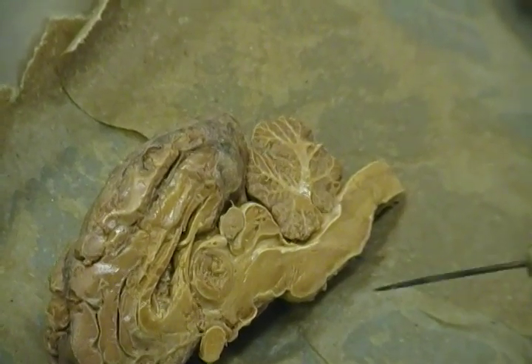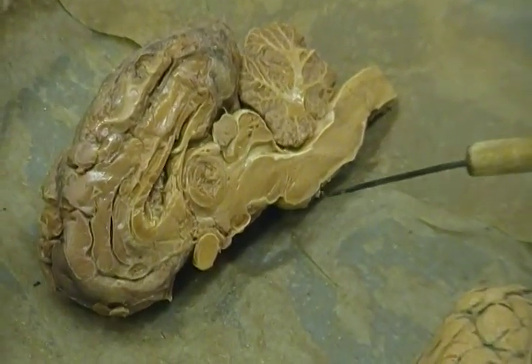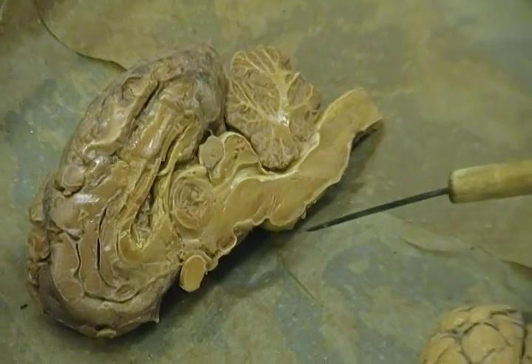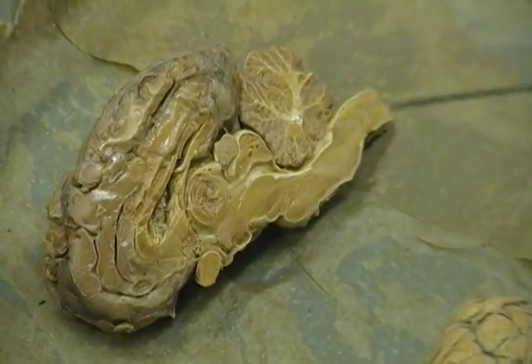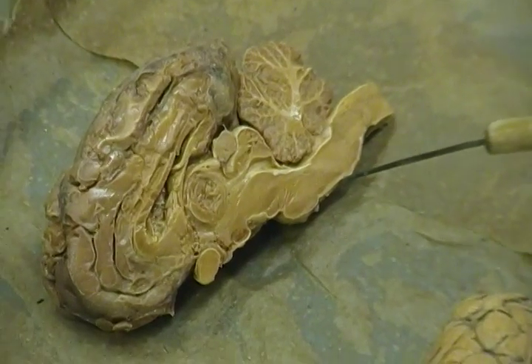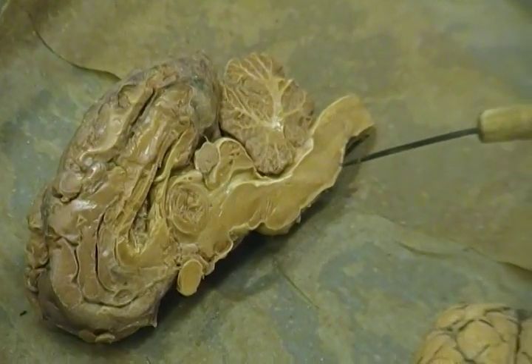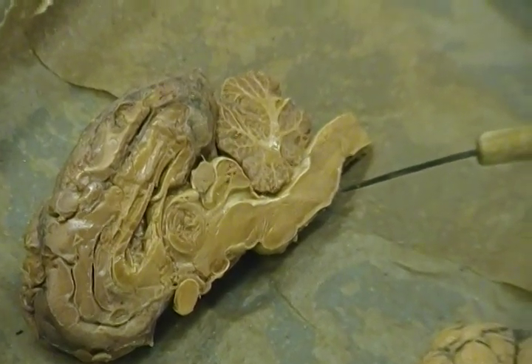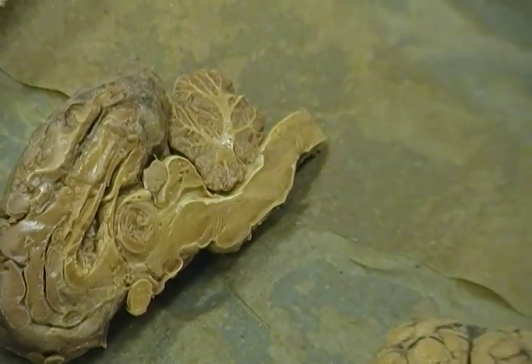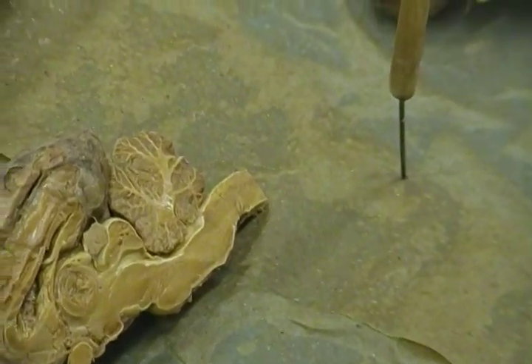All right, guys, I've asked you just about everything I can ask you on your test. Two more questions. There's a bulbous area here that helps to control respiration, has a lot of tracts in it. Pons, and there's one just beneath it that has a cardiac center, respiratory center, and vasomotor center. Medulla. What's its last name? Oblongata. You guys just passed that part of your lab test.